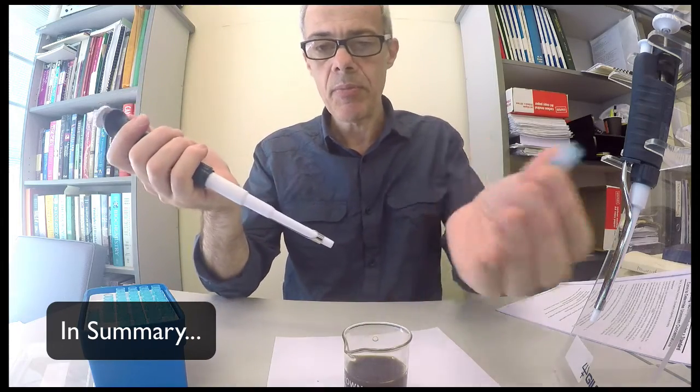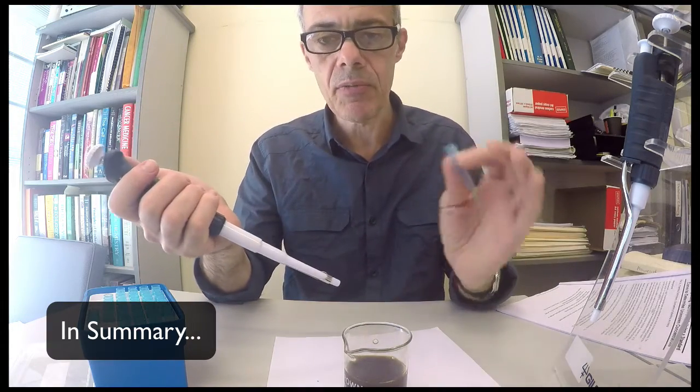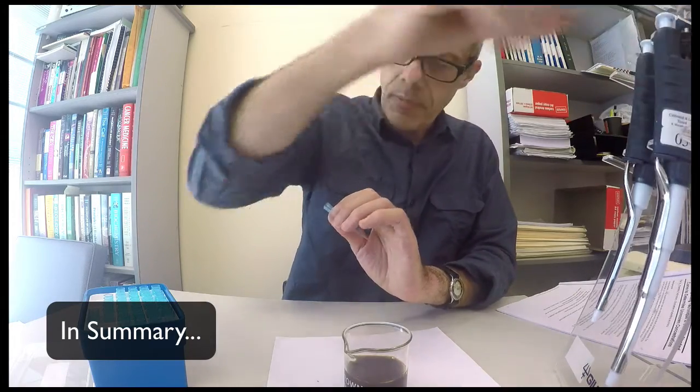And then I use this other button here to dispense the tip, so that I can dispense the tip into a waste container, not into my hand. And again, keep the pipette upright whilst you're pipetting to avoid any back flow into the pipette itself.